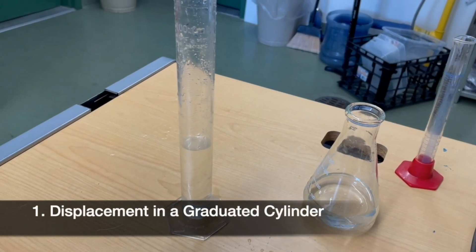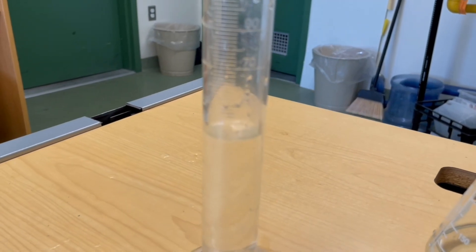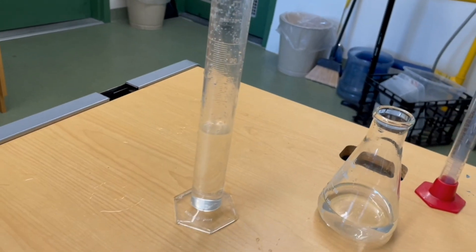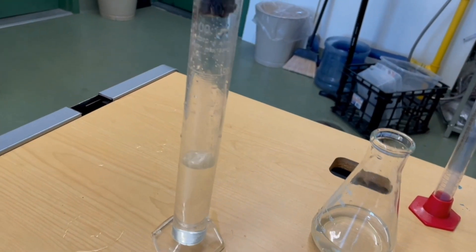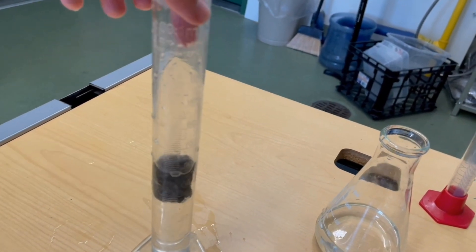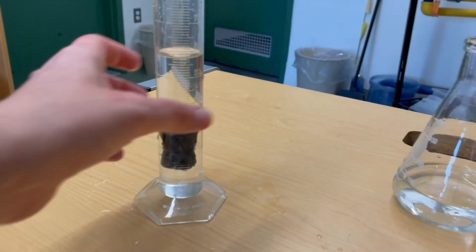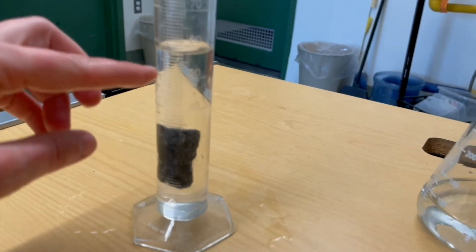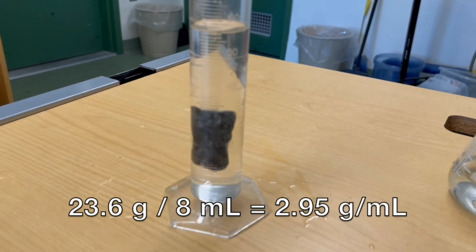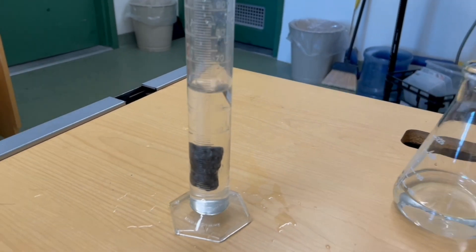If your rock sample will fit into a graduated cylinder that has single milliliter gradations, you can measure the displacement of water directly in the graduated cylinder and get a very accurate volume for your rock that way. It helps to have the water fairly far down so that when you put the rock in it doesn't splash water out. You can tell how much volume the rock takes up by observing the rise in water level from the initial to the final volume. This is an oceanic rock, so its density comes out close to three grams per milliliter or three grams per cubic centimeter.